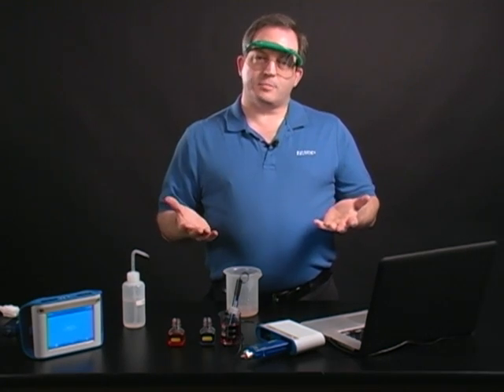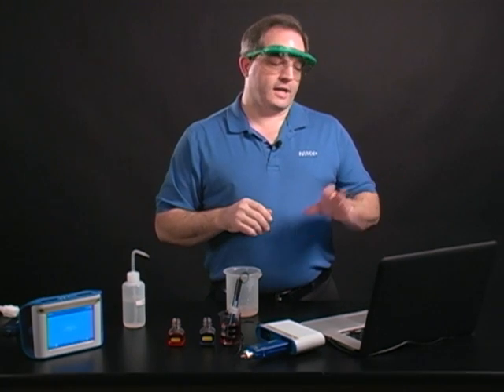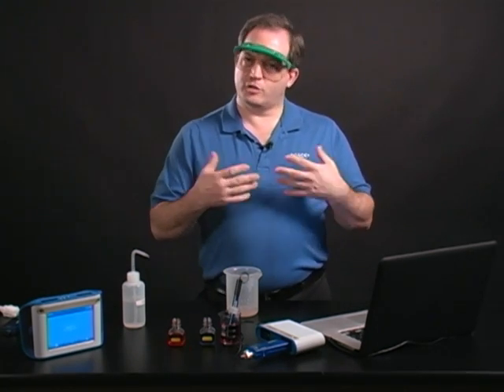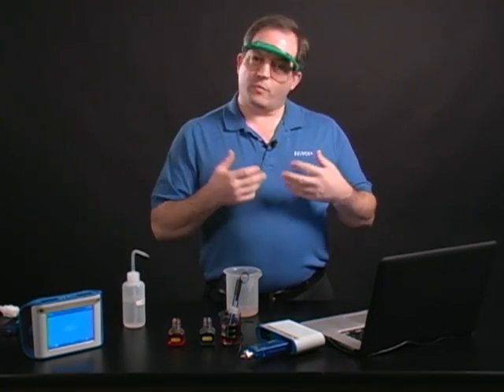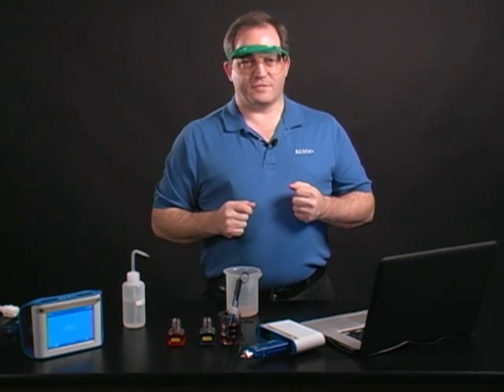I only have to do this once at the beginning of an experiment typically, so I can now go on and do several measurements. As long as I'm still using this file, I should be OK. We hope you enjoy using this sensor with your students, and don't forget to practice safe science. Thank you.